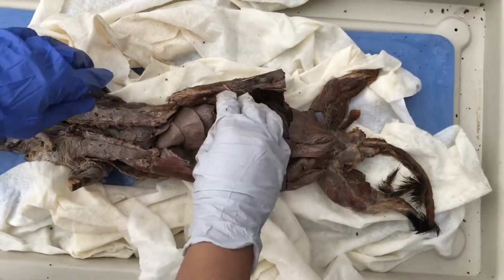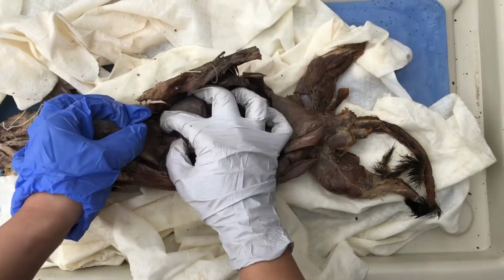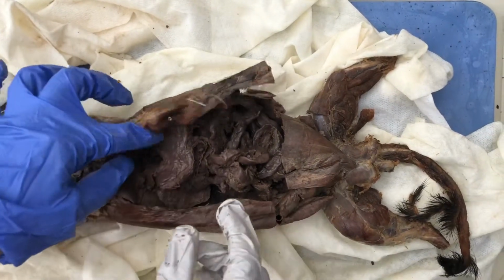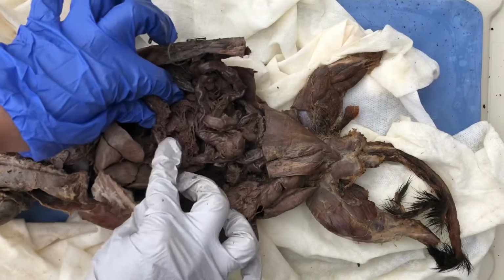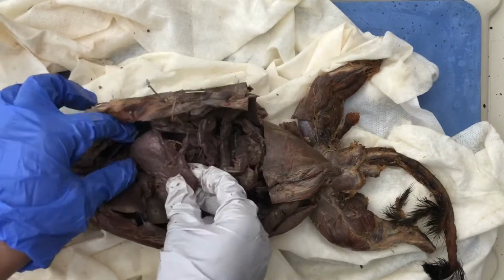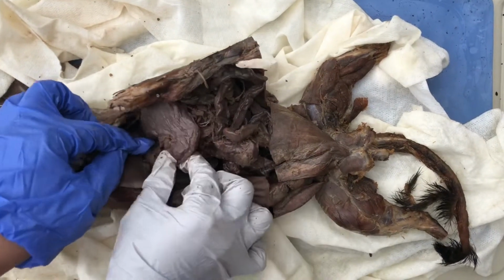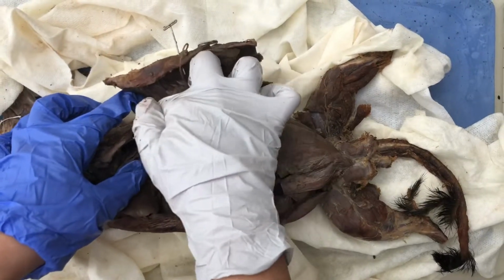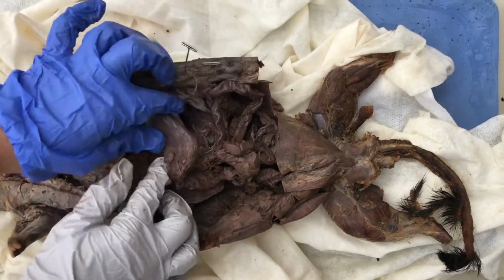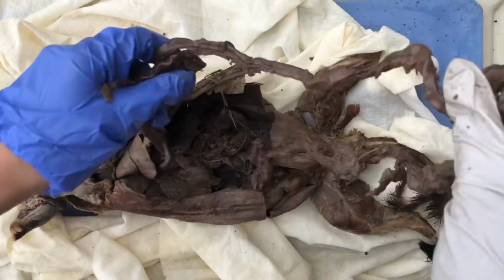So this is the stomach, and if you can see in this area here is the cardiac sphincter where the stomach kind of begins, and then over here where it connects to the duodenum is the pyloric sphincter. The body of the stomach is right here, and the pylorus of the stomach is right here next to the pyloric sphincter, and this area here is the fundus, and this is the greater curvature, and this curve inside is the lesser curvature. And then the large intestine and the small intestine, which are right here.